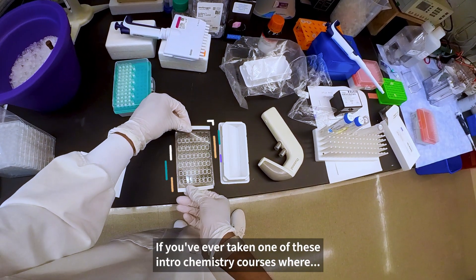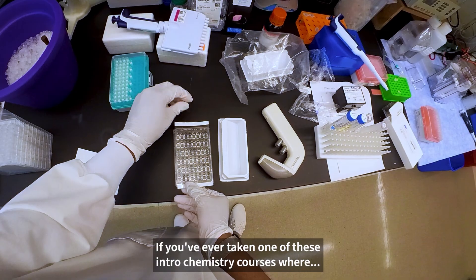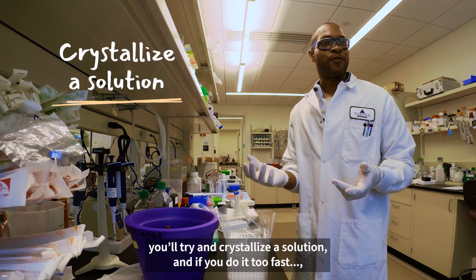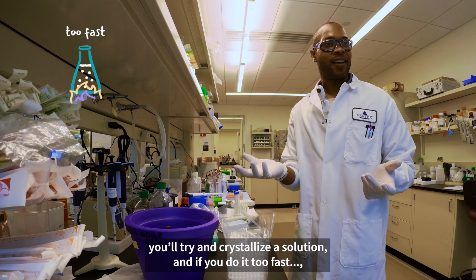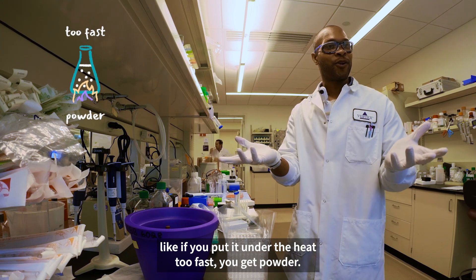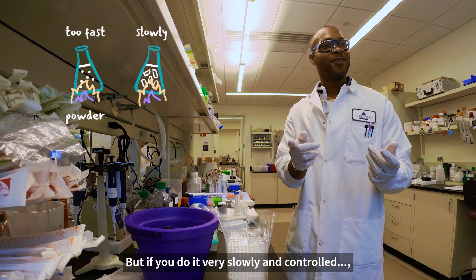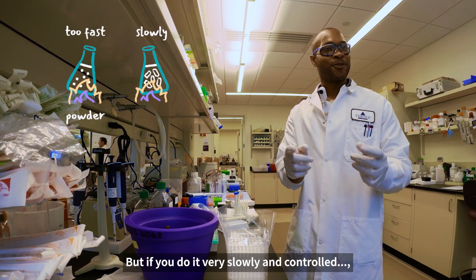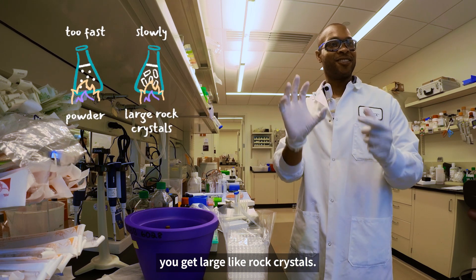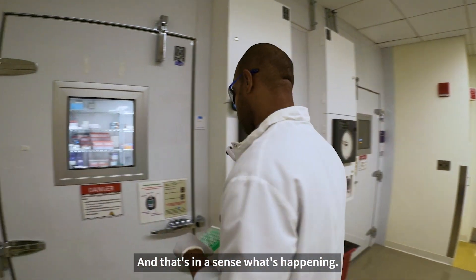If you've ever taken one of those intro chemistry courses where you try to crystallize a solution — if you do it too fast, like if you apply heat too quickly, you get powder. But if you do it very slowly and in a controlled way, you get large rock crystals. And that's in a sense what's happening here.